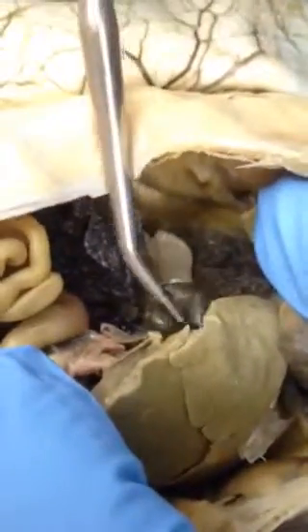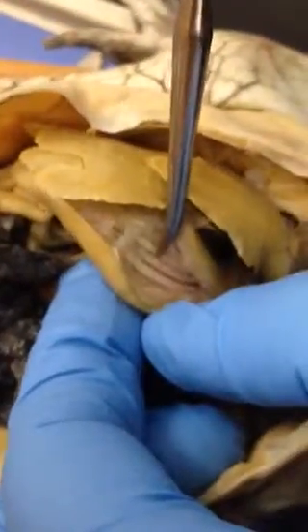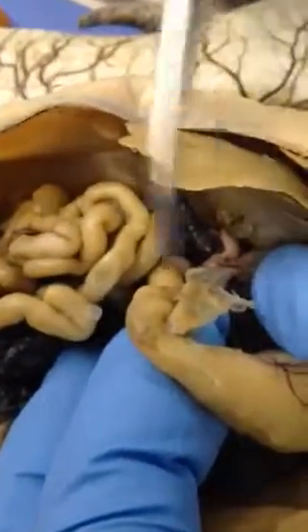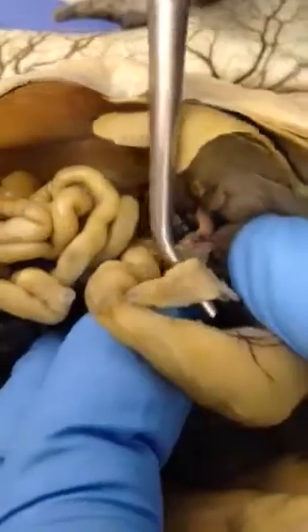Attached to the liver we have a gallbladder right here — bile storage. Going straight through the esophagus leads to the stomach, which looks pretty awesome. The stomach leads to the small intestine right here. Attached to where the stomach and small intestine junction is, is the pancreas.